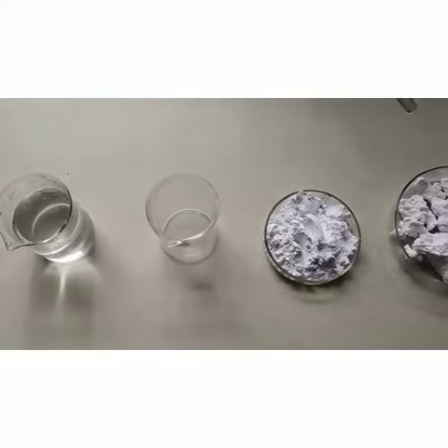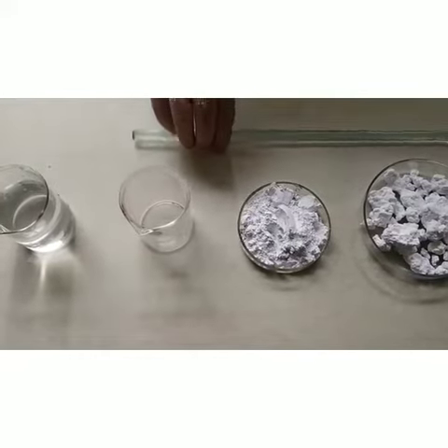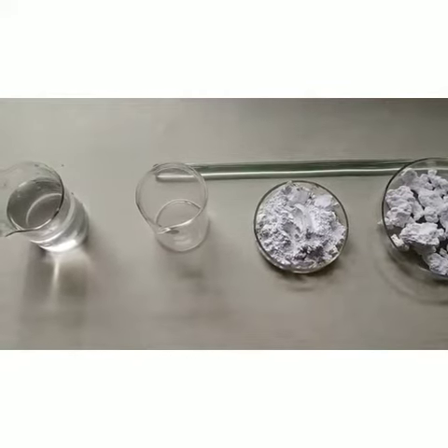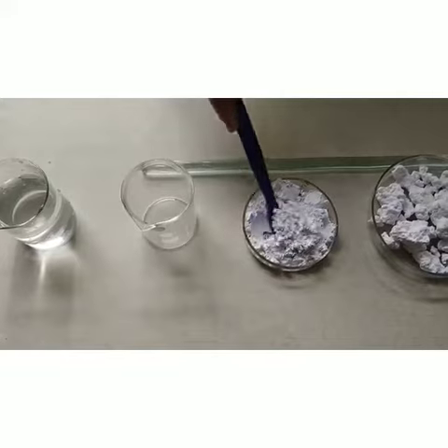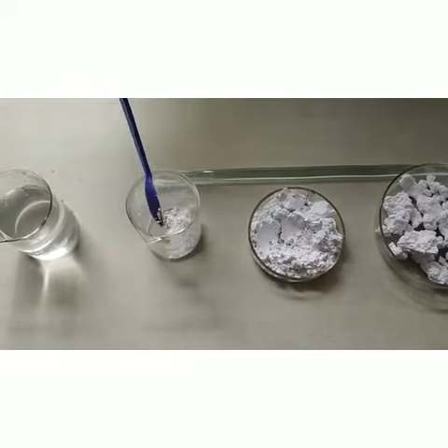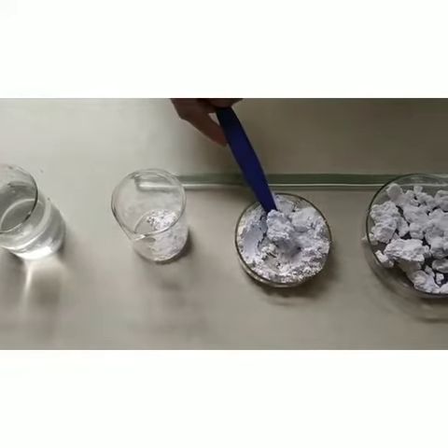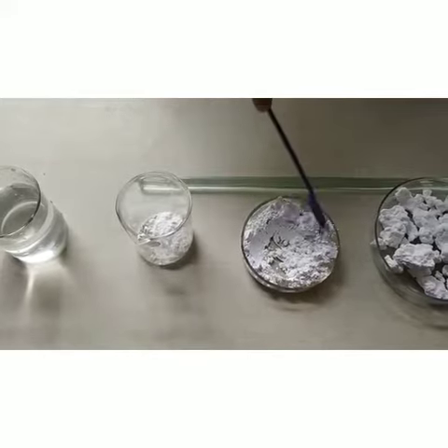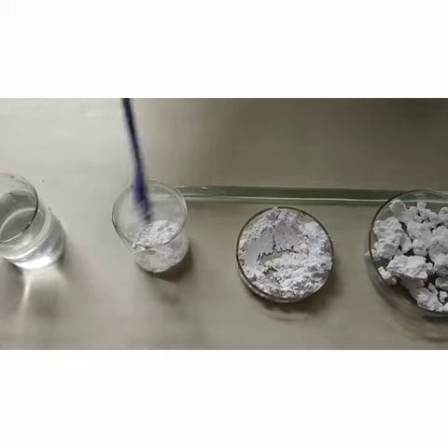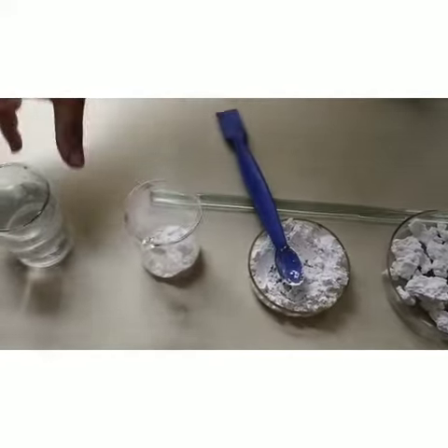Here I will take calcium oxide powder in our beaker and I will add some water in it. So you observe the reaction.